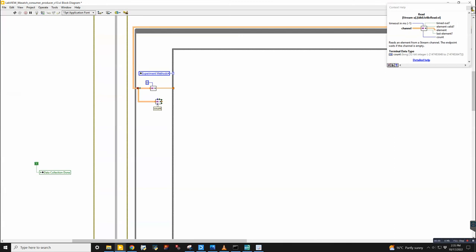You can output the count. I've never really used that. Most of the time, I just wire a 0 into here, and then I just send out the data. Sometimes I use this element valid. That can be helpful, but usually I don't.